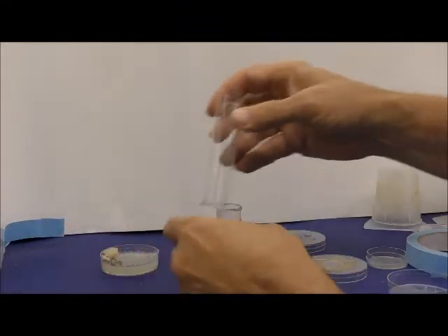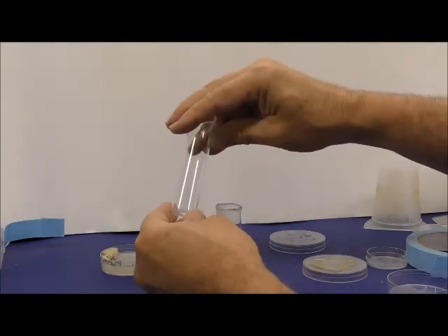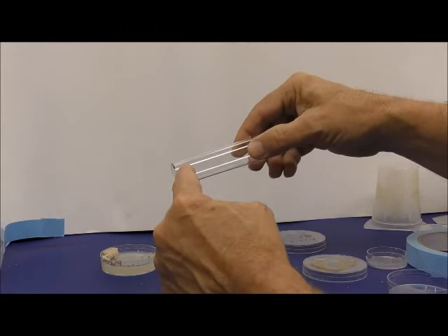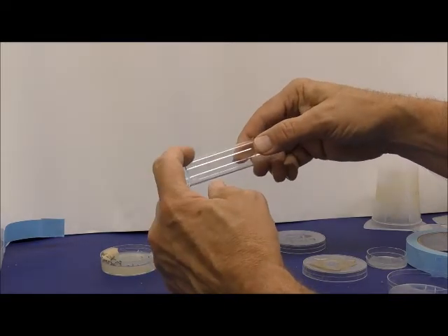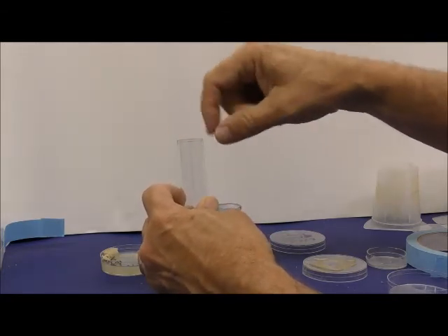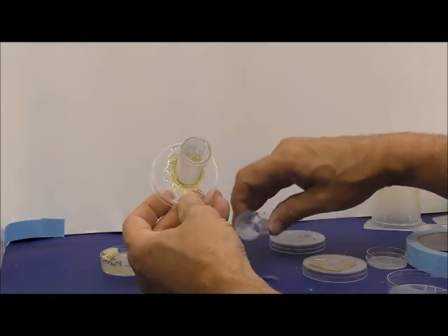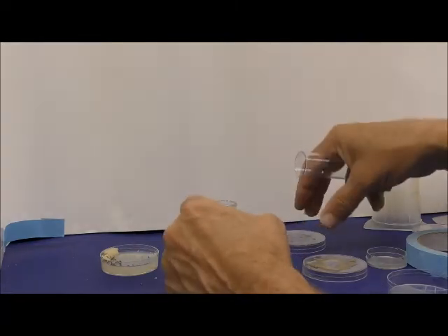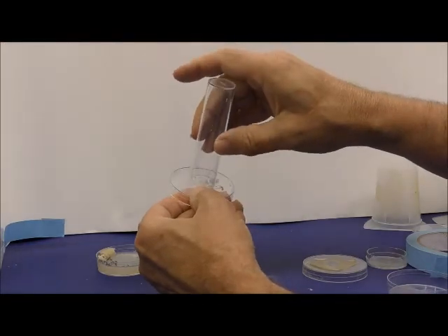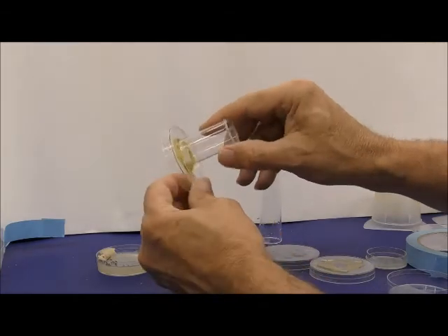You can take the normal fly vials. You can cut them off or leave them the way they are if you want to. If you cut it off here, they tend to crack. So again, a soldering iron helps to get rid of the one end. Just use the soldering iron, melt it off, and then take it off. And when you have that, it kind of leaves this little thing like this. And then what we do is we make a hole that's smaller than the hole of this. And you can then put that on like that and then glue it with epoxy glue.